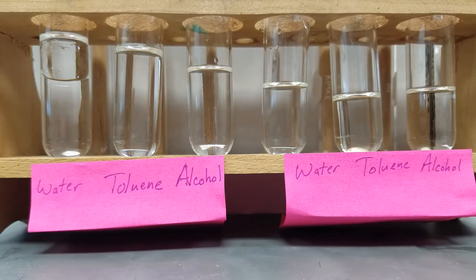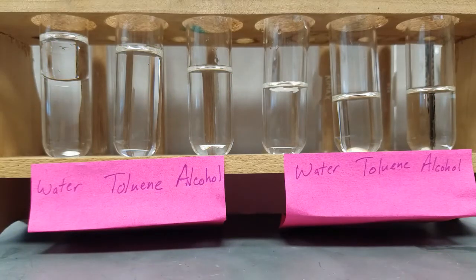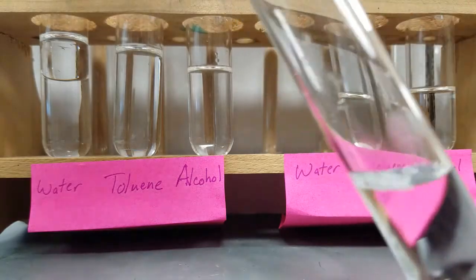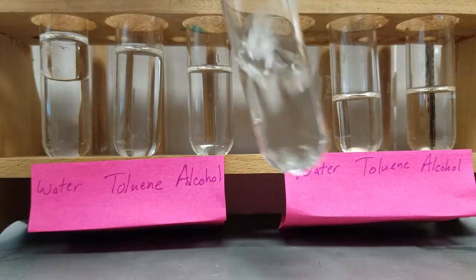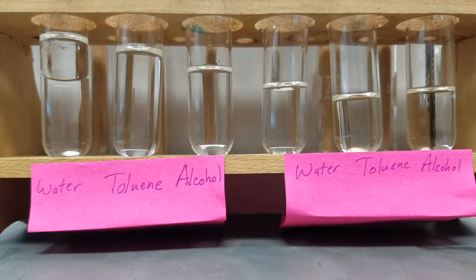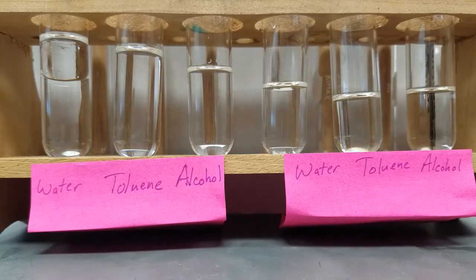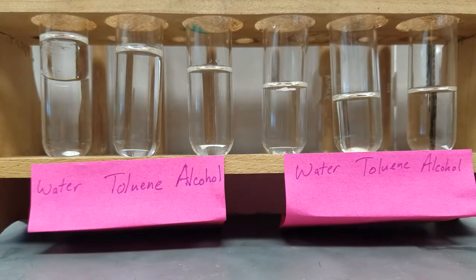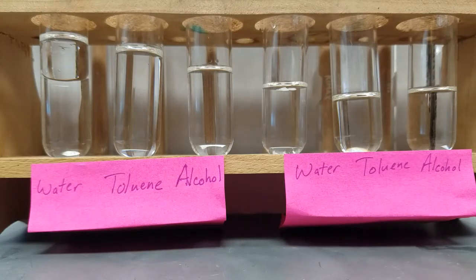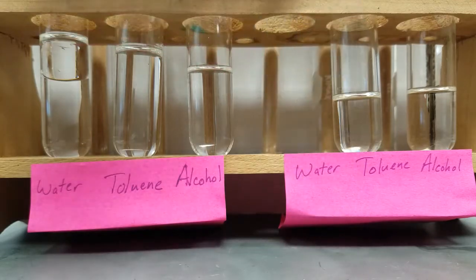Now we're going to try a known solid — this is naphthalene. We put naphthalene in water and you'll notice it's floating on the surface of the water. We add a little bit of naphthalene to the toluene and to the alcohol. For solids it sometimes takes a little bit of time and we need to stir it up. For our water, you can see the white naphthalene still sitting in the bottom.